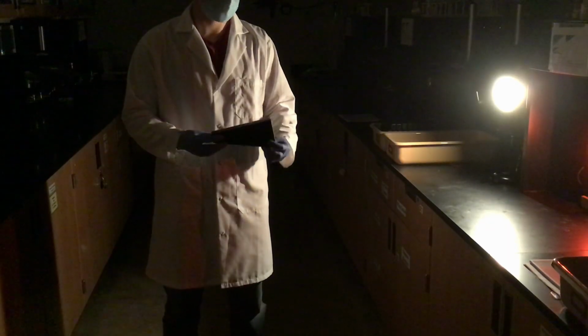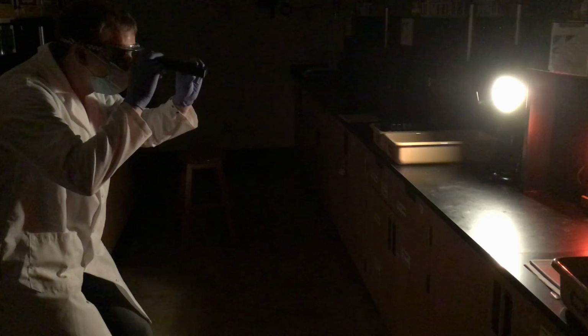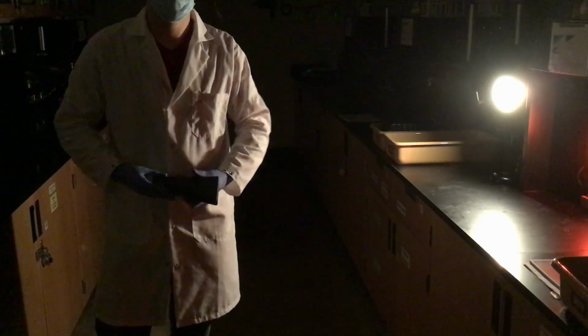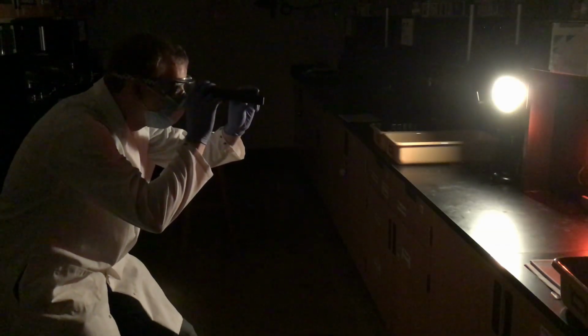In order to use your handheld spectroscope, you will have your power supply in your hood that I have over here. You need to stand about a meter away, crouch down, and peer through the spectroscope until you can find the light. When you have it, you should start to see the diffraction on the side of the spectroscope, and you will be able to see the wavelength of light. So as stated before, stand about a meter away, get a head-on view of the lamp, and look.